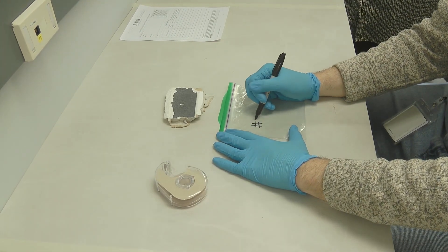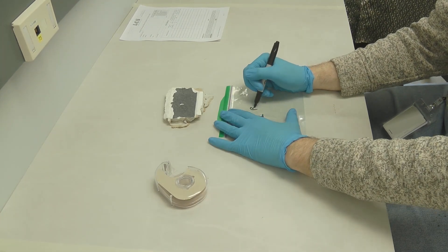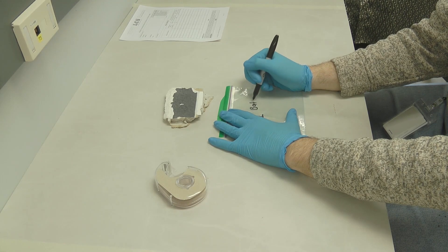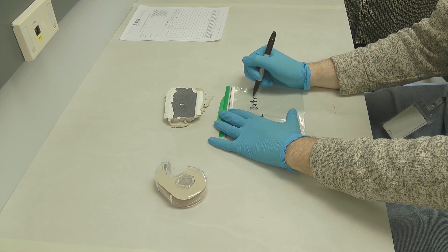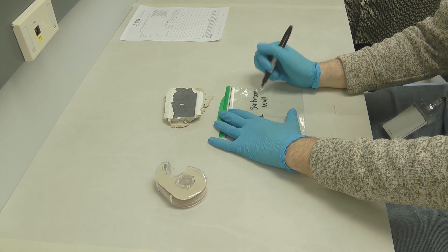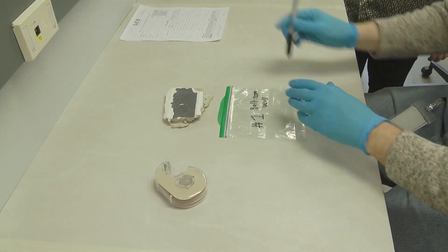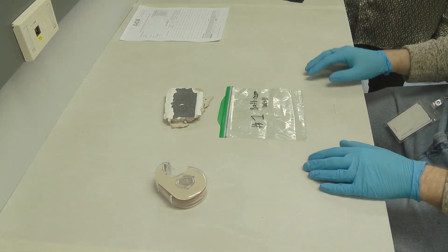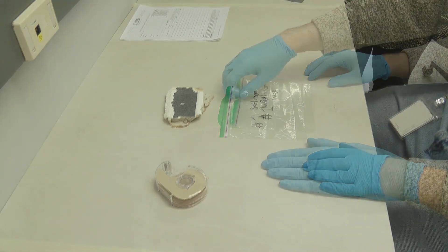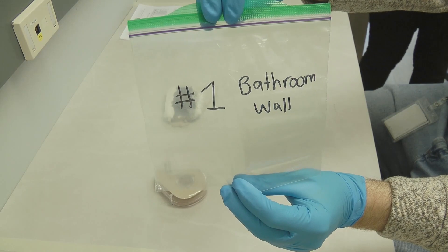Write down on the bag the location of the sample taken — for example, sample number one, bathroom wall. If you need to take another sample, please repeat the same sampling procedure with a fresh piece of tape and a new ziplock bag.